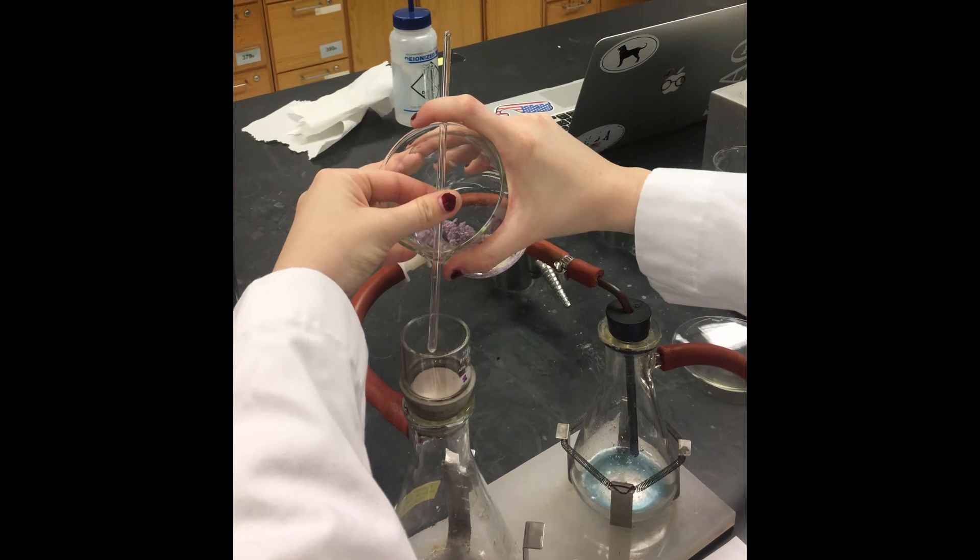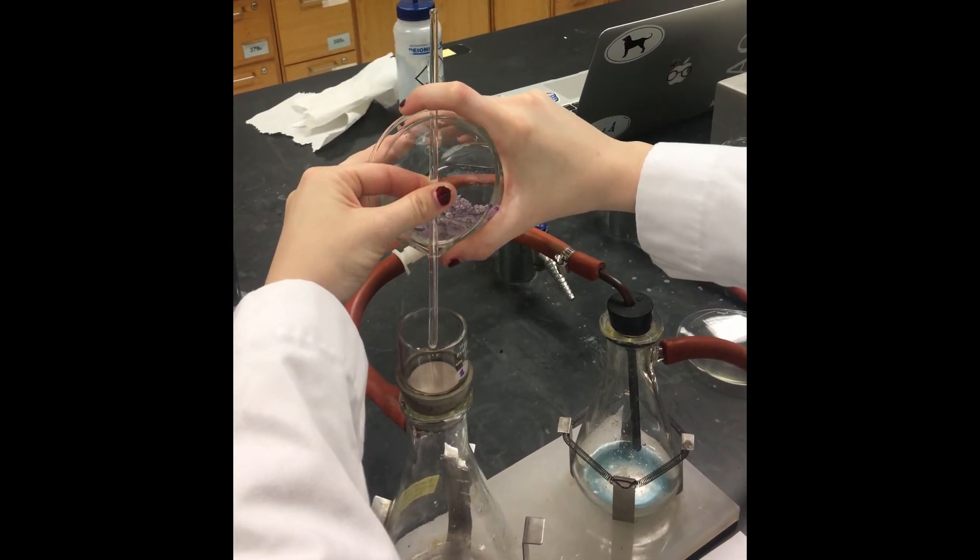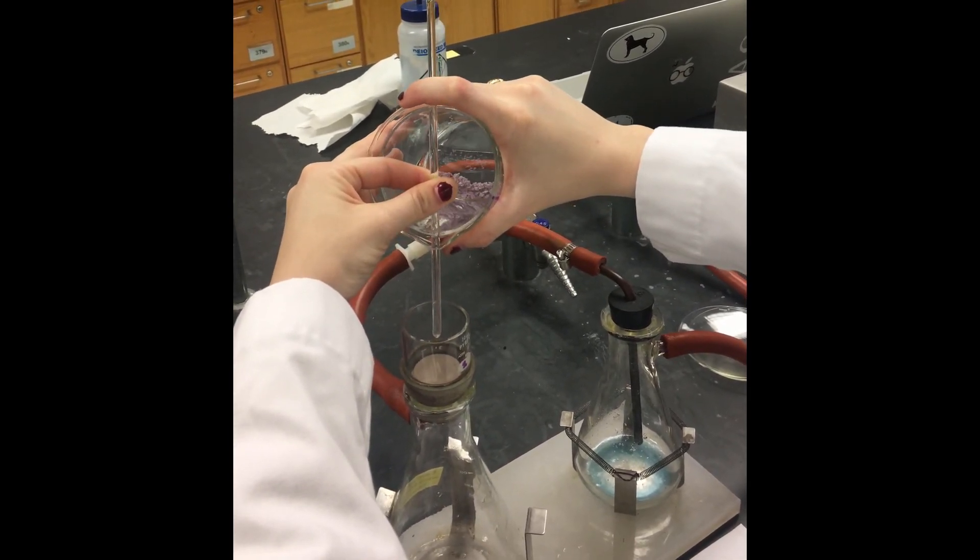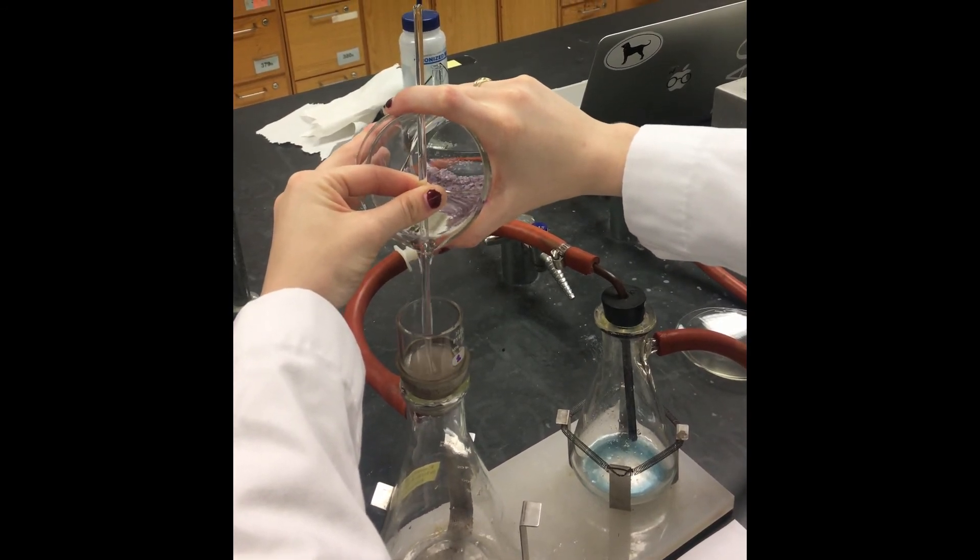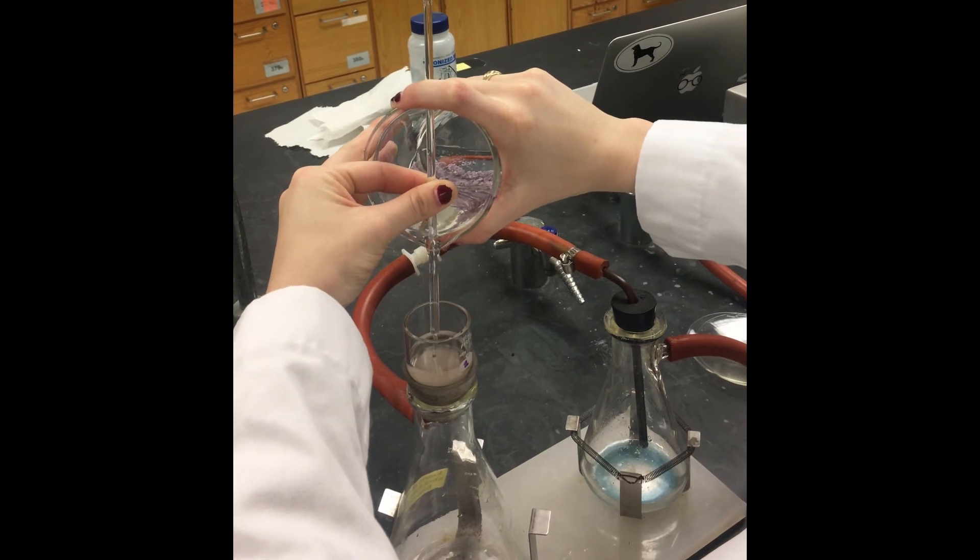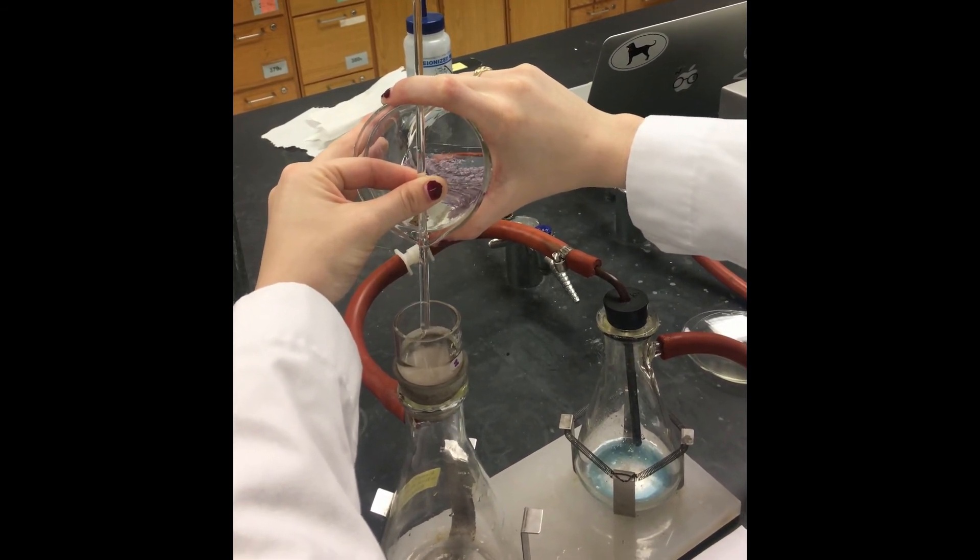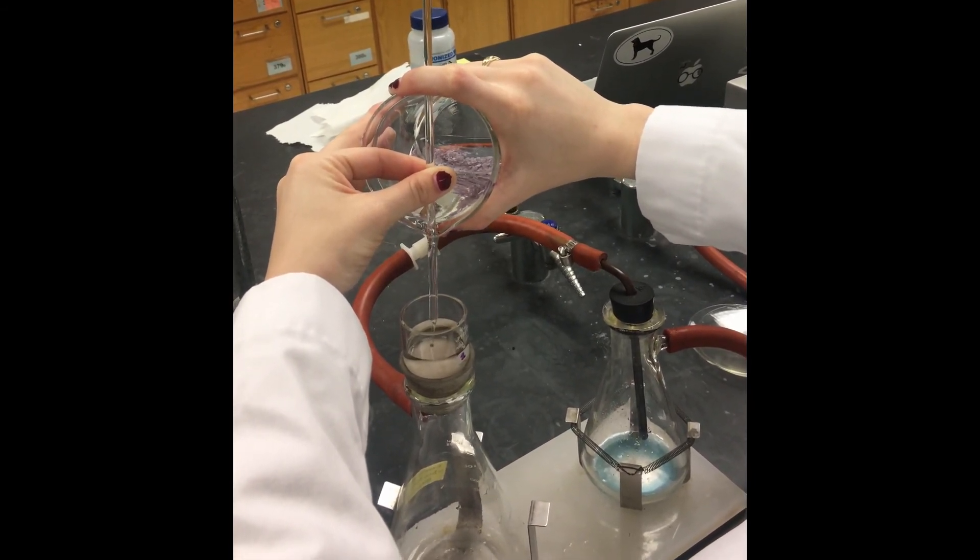Decant only the liquid into the crucible, which is set up on your filtration apparatus. The shown technique is preferable because it will allow you to transfer only the liquid and none of the solid. When the solid is retained, it is better rinsed later.